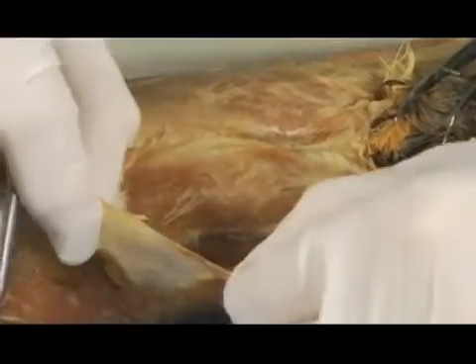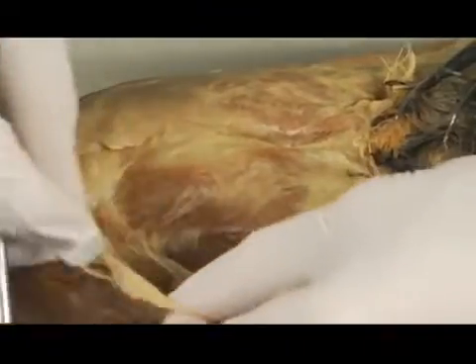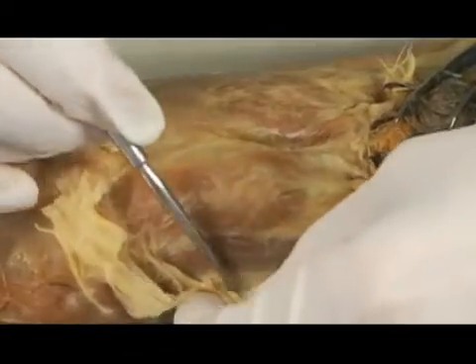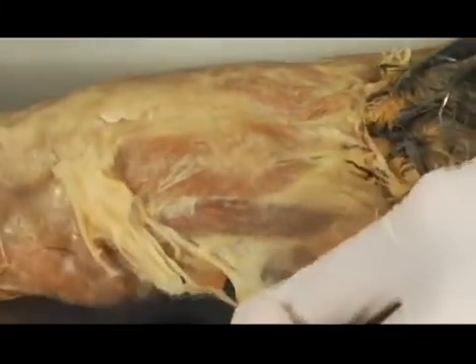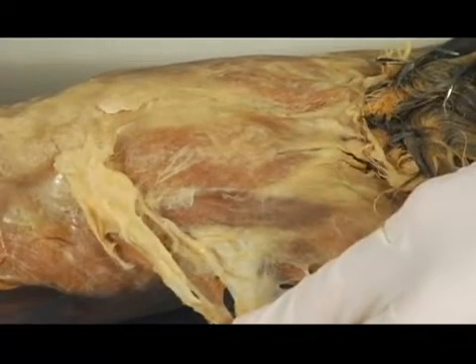So again, you're seeing that I'm getting some of the stuff off here. It's being removed. The blunt probe is helping me. I won't really tear anything with that blunt probe, so I'm in pretty good shape with that. And that's why you want to use a tool that will get you what you want and not cause a lot of damage otherwise to the tissues that you want to see.